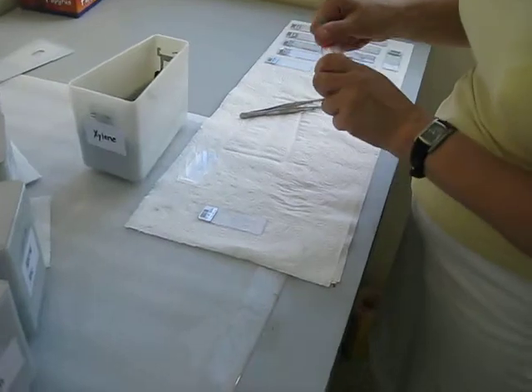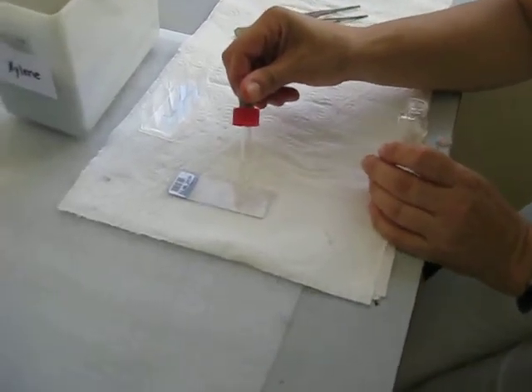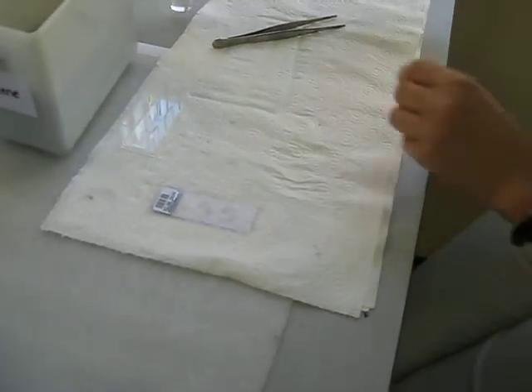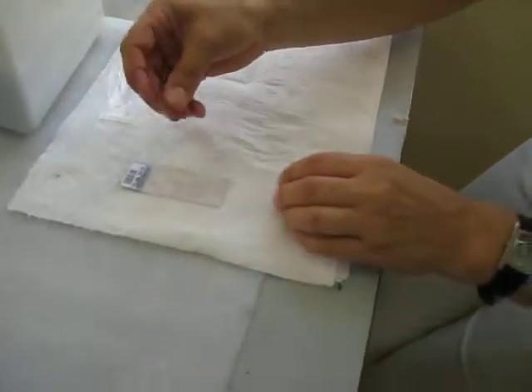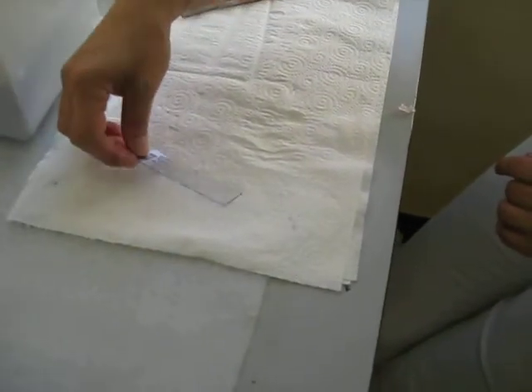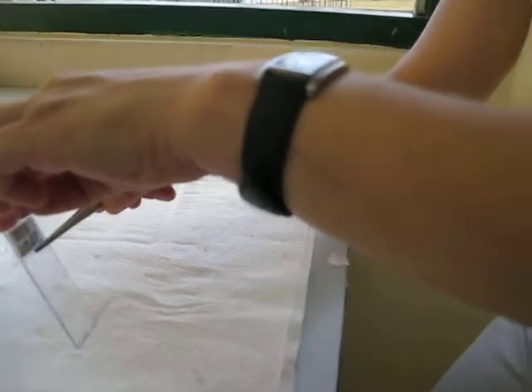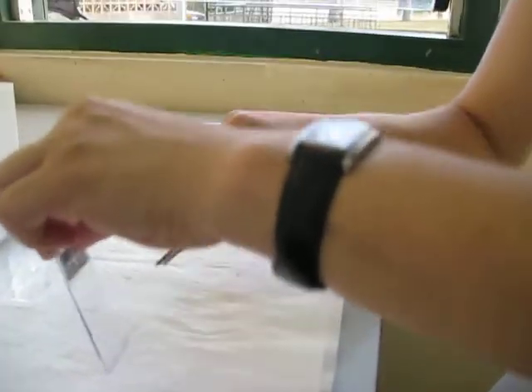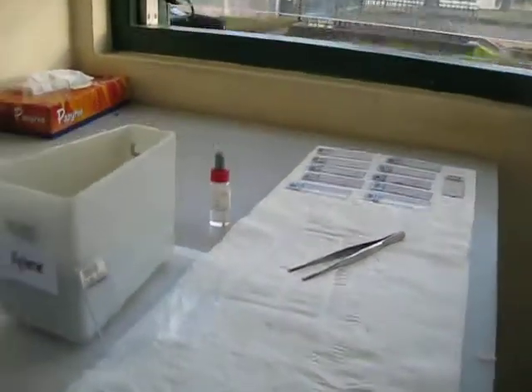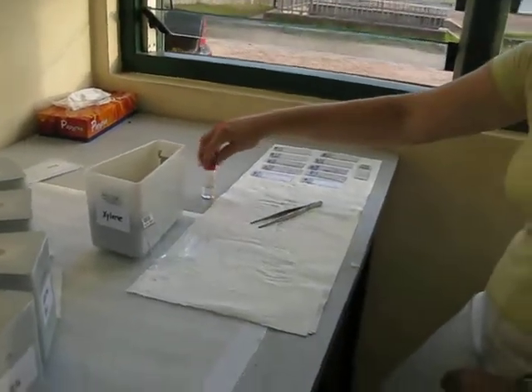She has DPX in a nice bottle; she puts two drops on the slide, then takes a cover slip and nicely drops it on. She then waits for a moment — the mountant spreads under the cover slip. She ensures there are no bubbles, the edges are clean, and keeps them standing upright for some time. That's basically it — you're finished; you wait for the mountant to set afterwards.